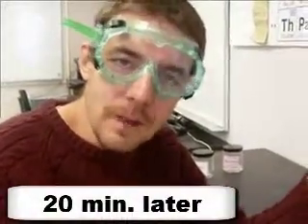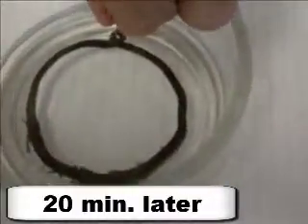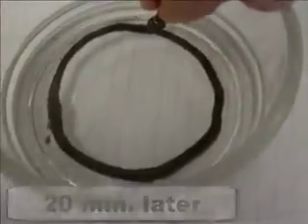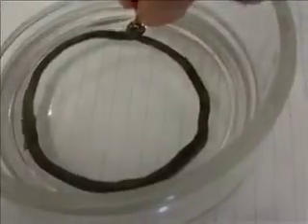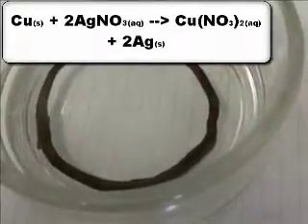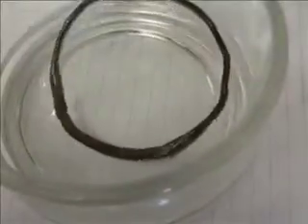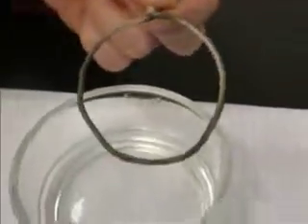All right, it's been about 20 minutes since we started our single replacement reaction. So let's take a look and see what we have here. So you can see that a lot of the silver that was in the dissolved solution in that clear and colorless liquid came out of the solution. It replaced the copper. So what it did is some of the copper that was on the copper metal became copper ions. And then the silver ions in solution became silver metal in the single replacement reaction. So you can see on here it's actually coated with silver. Ooh, you can see really well there on the backside.